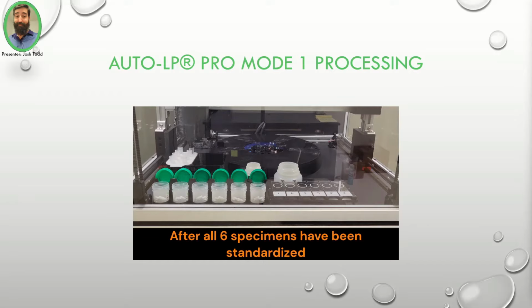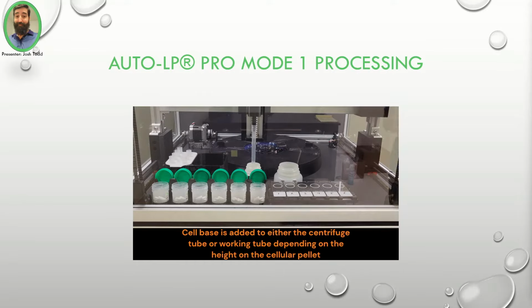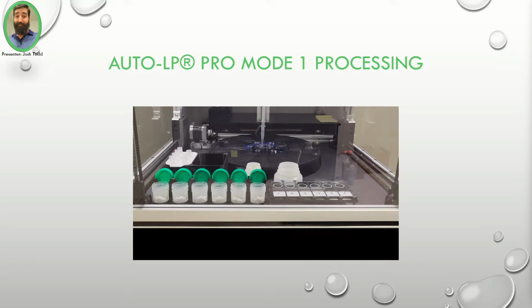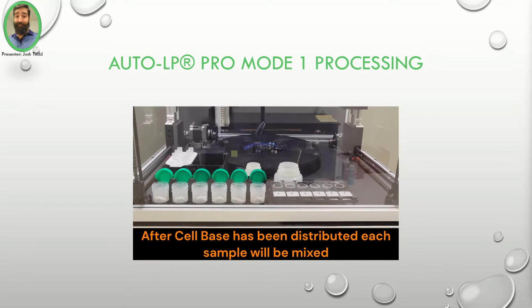After all 6 specimens have been standardized, cell base is added to either the centrifuge tube or working tube depending on the height of the cellular pellet. In this example, all 6 specimens showed cell pellets larger than 2 millimeters and will be processed in the working tubes. After cell base is distributed, each specimen will be mixed and then added to the appropriate working tube.